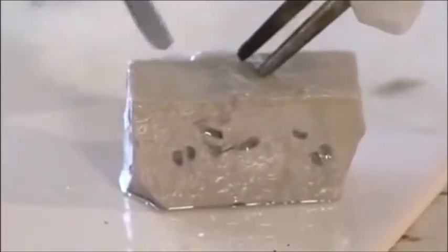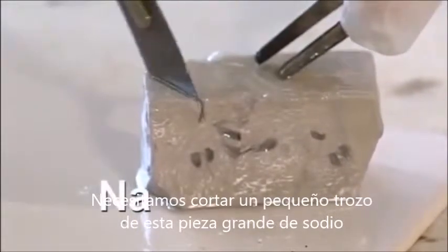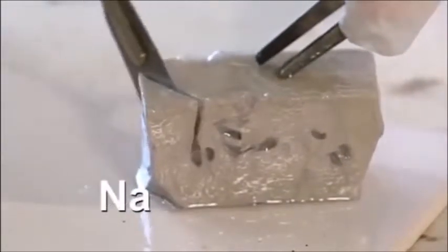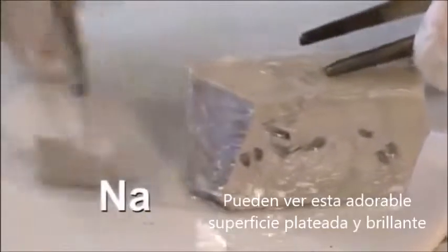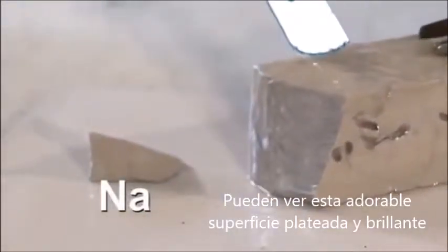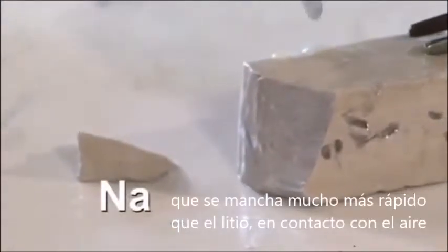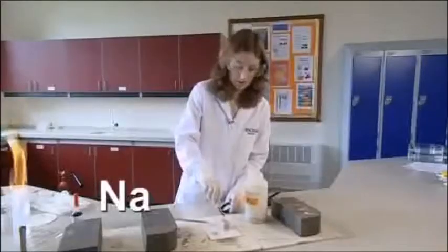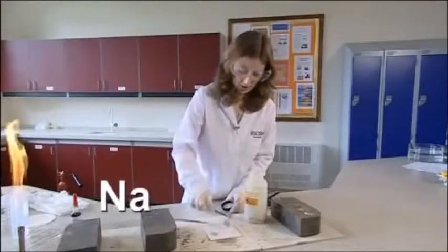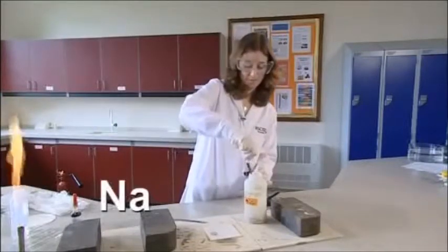Okay, so we need to cut a piece of sodium off this large piece. And you can see the lovely shiny silver surface that tarnishes much quicker than the lithium in air. That large chunk goes back in the oil.